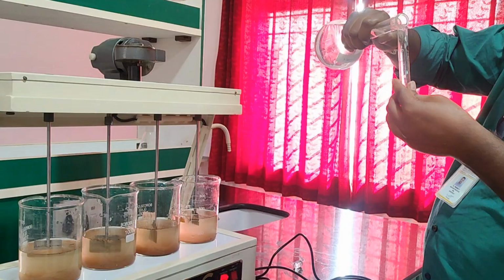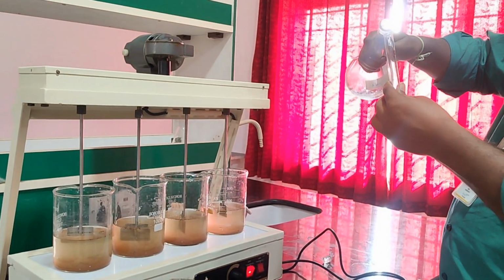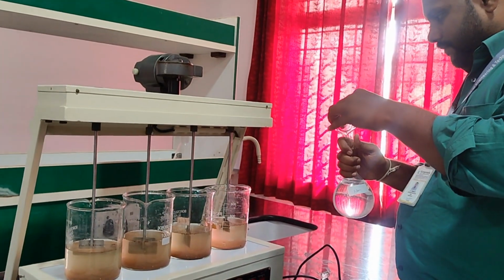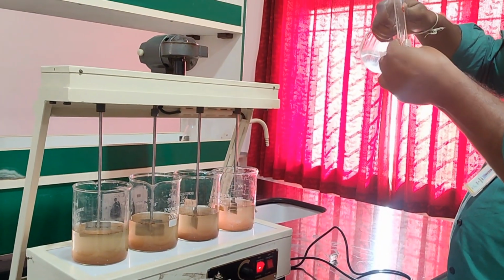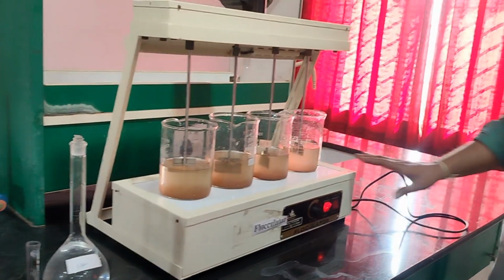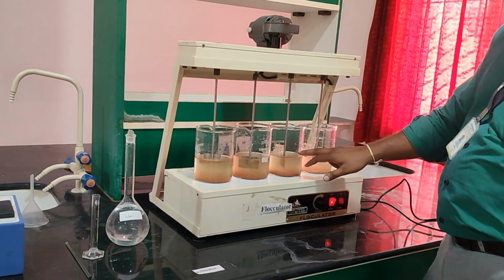And for the second I am measuring around 6 ml of alum. Before using it, shake the alum solution. And for the fourth, I am taking 10 plus 2, that is around 12 ml. So this is the alum solution. First, you can see the apparatus we have used here: just a flocculator machine with the flocculating blade, and alum as our solution. I have measured my alum solution in different values, that is 3, 6, 9 and 12.